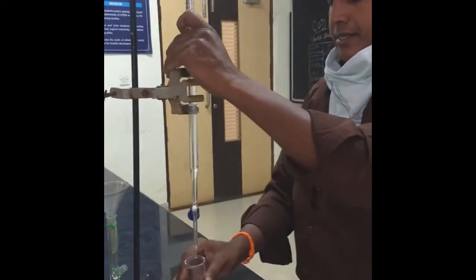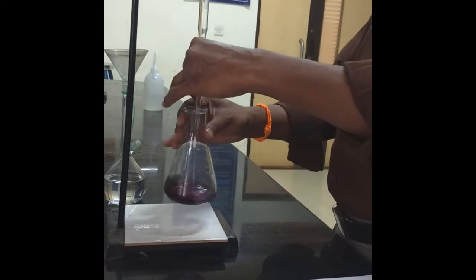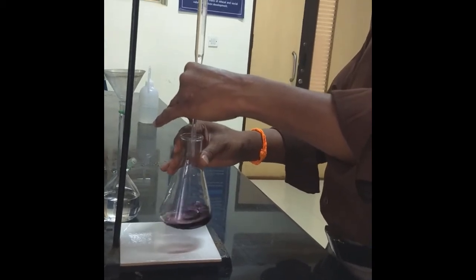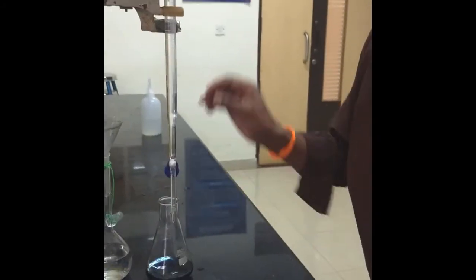Then you need to titrate until the wine red colour changes to clear blue. When nearing the end point, you will see that as the burette solution is added, a little tinge of blue colouration appears. When it is appearing slowly, you need to add it just nearing the end point. The colour changes from wine red to clear blue. Note down the reading — the reading I am getting is 6.8 ml.